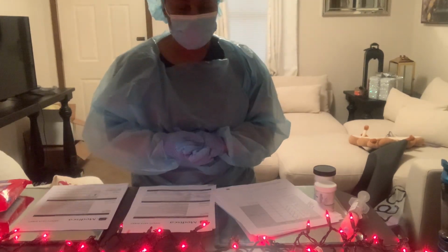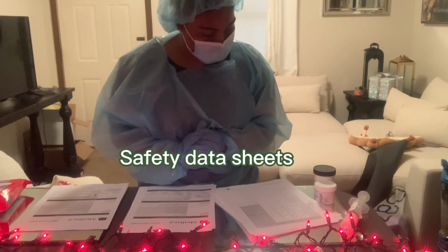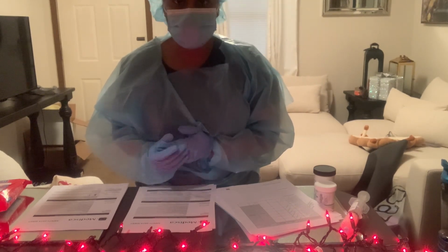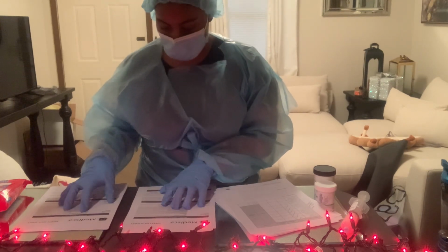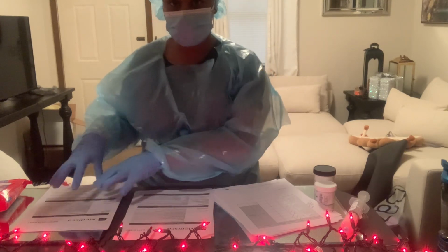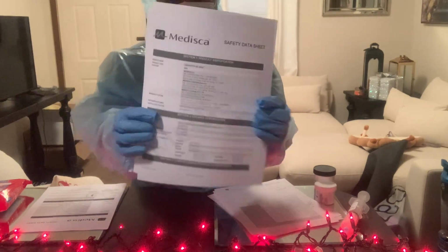So we're going to locate the safety data sheets, and we're going to review all the ingredients provided on the safety data sheet. So these are my 2 safety data sheets that I found. And again, this is the gel base and then the testosterone. So this is that one.